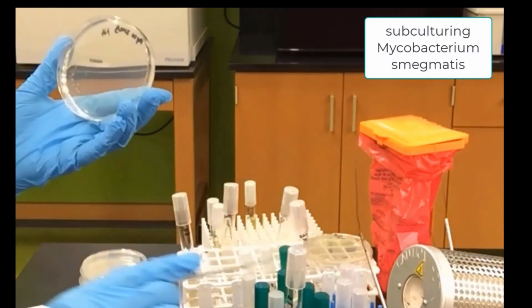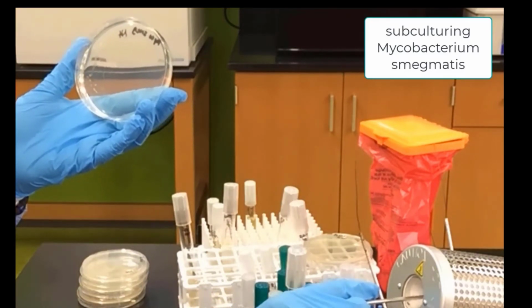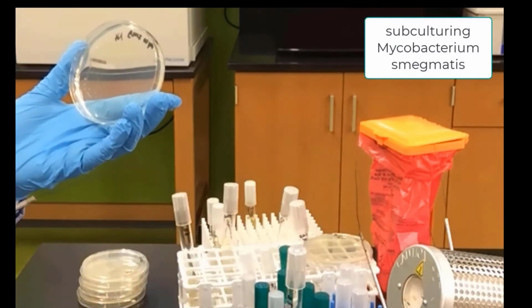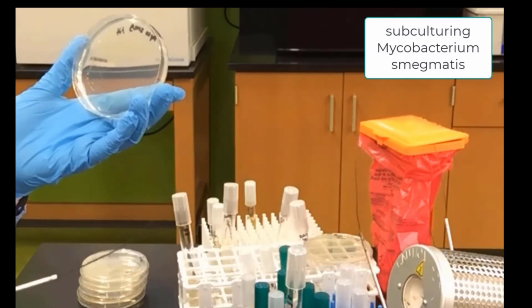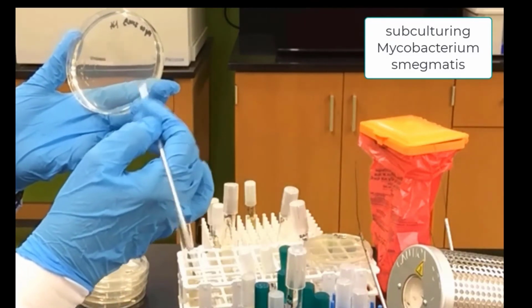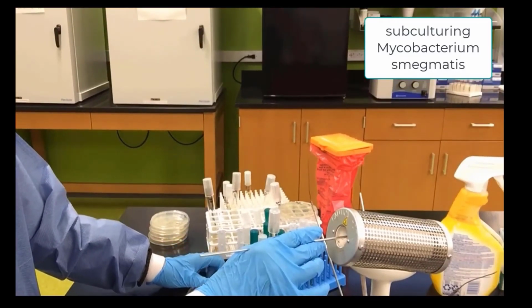Turn 90 degrees, sterilize our loop, let it cool, and now we are ready to drag bacteria from the second streak into the empty space, making a third streak. The plate is now complete.